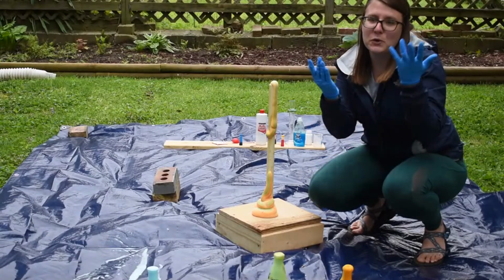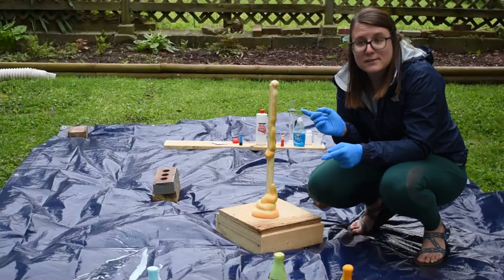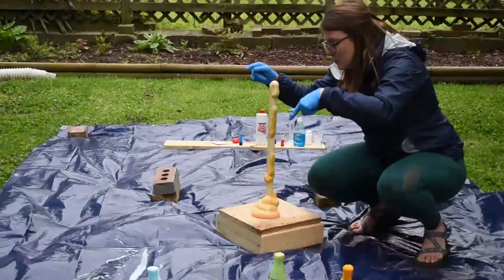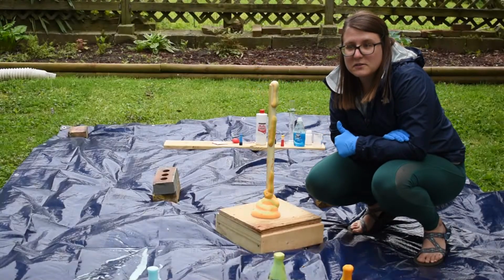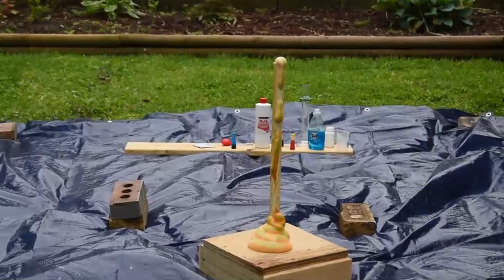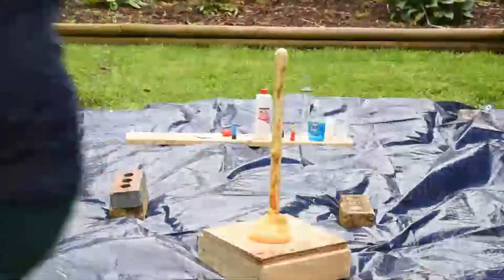It didn't quite shoot out like Mentos and Coke style like I was thinking it would, but we did get it to look like toothpaste. So there we go. We'll just let it keep going. It's definitely got the toothpaste stripes going on. I have a feeling this will do its thing for a little while. So we're going to zoom in a little bit more.